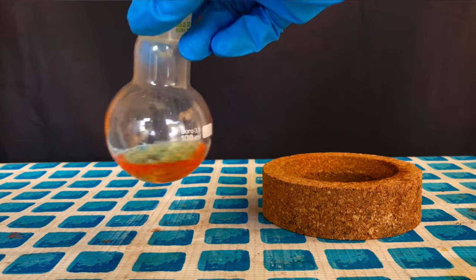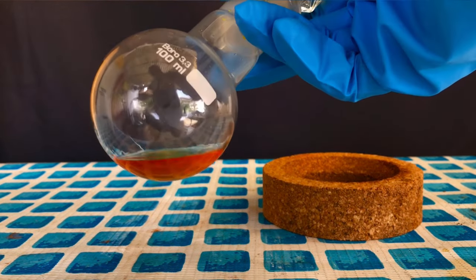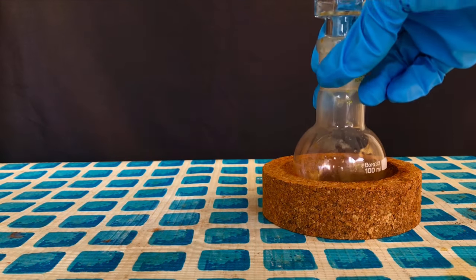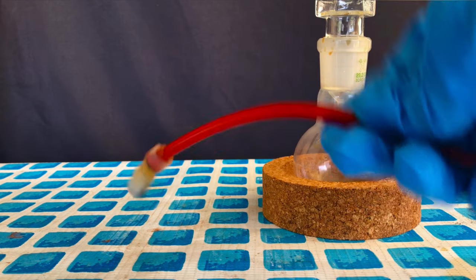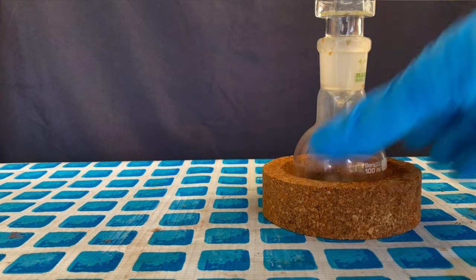Well, the problem, why it is not perfectly clear, is that in the hose connected to the gas scrubber, there was still some bromine left, which created phosphorus pentabromide in the flask. But the product should still be useful for my purposes, which are brominating alcohols.